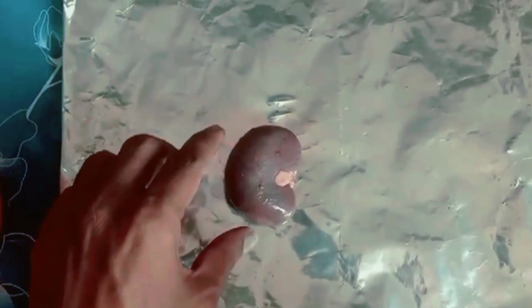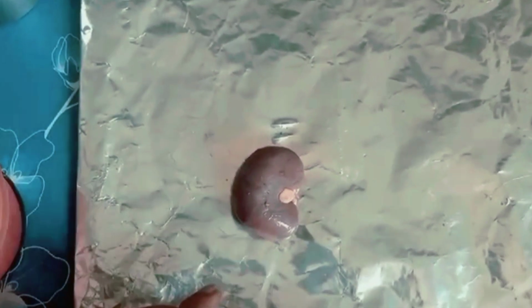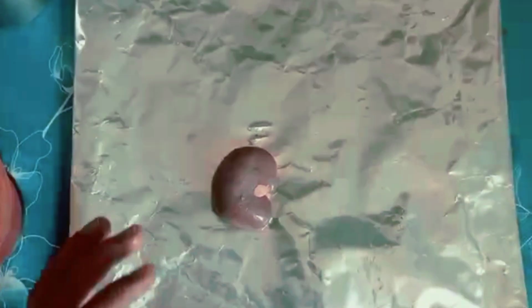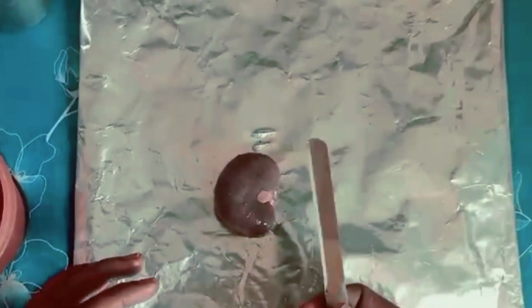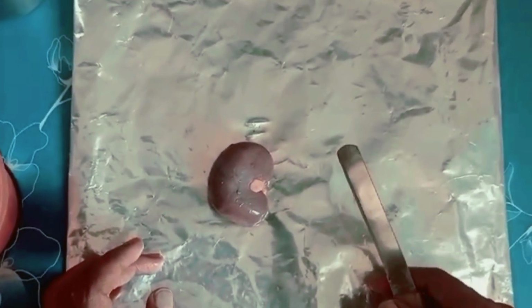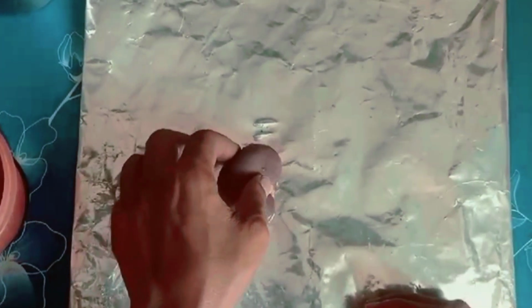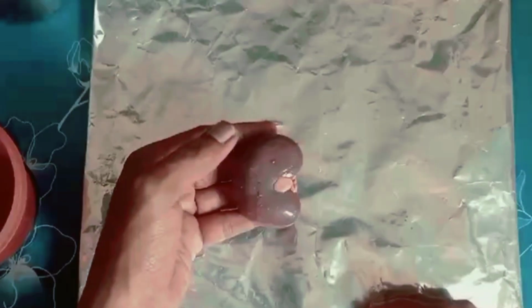And this is generally reddish brown in color. And for doing this activity, we need some materials. One is the freshly collected goat kidney, and we need a jug of water for cleaning the kidney, and we need a table or a tray, and we need a sharp blade to cut the kidney to see the internal structure of the kidney, right?